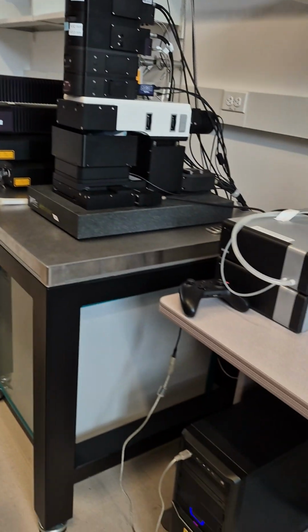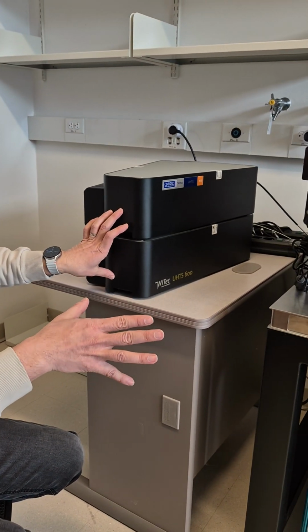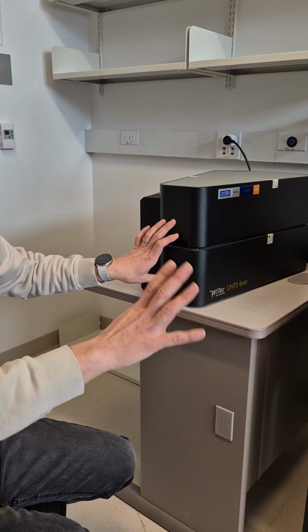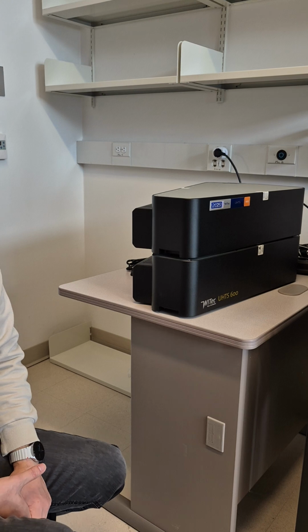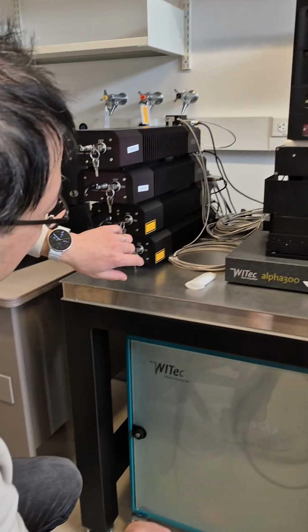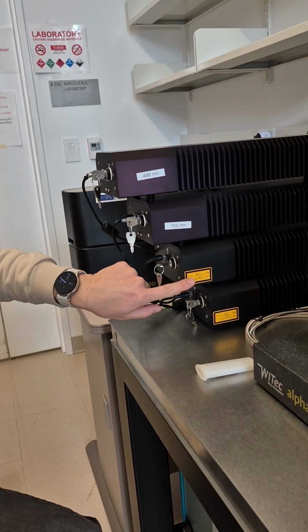And while we are waiting for that one, we can start from this side. This is the two spectrometers. We have 4 lasers that cover visible and infrared. So one spectrometer is for visible, one is for infrared. How do you tell which spectrometer you should use? A simple way, you just look at the wavelengths. For the shorter wavelengths, 488 and 532, you use spectrometer 1.